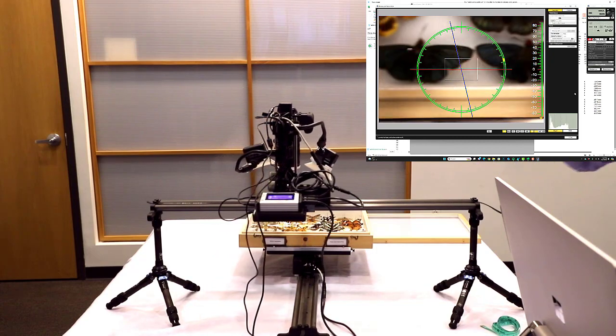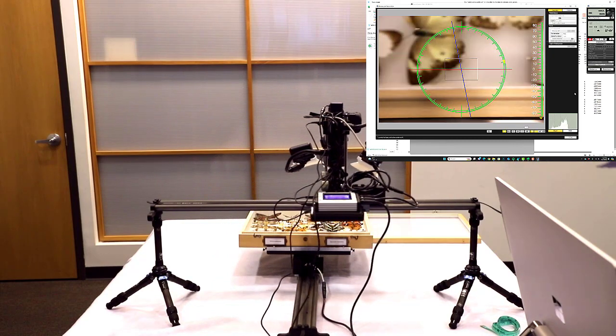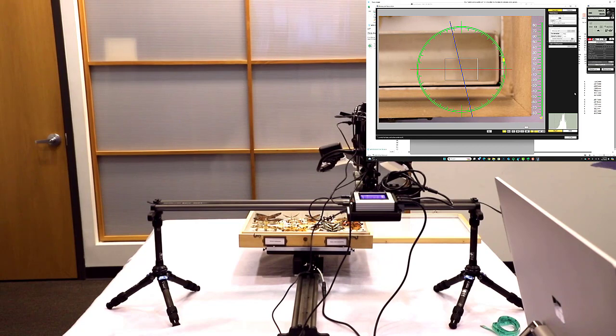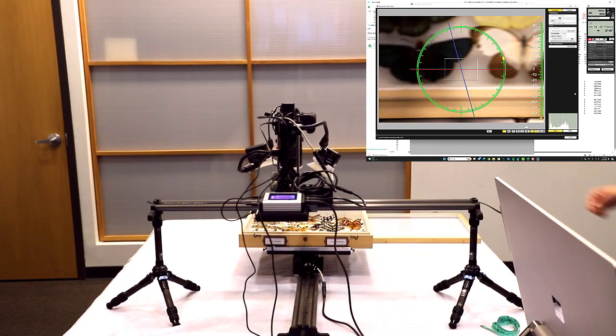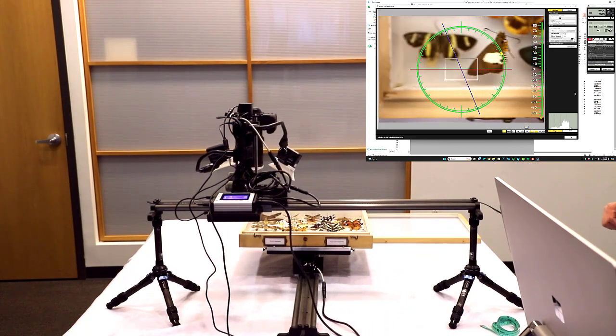So what it's going to do is it's going to take a picture at the starting point, the end point, and I can't remember correctly, but I think it should go right back to the starting point after this is done. Yep. So see, that's all done. You can do the same thing with every axis just to make sure that you're set up correctly.